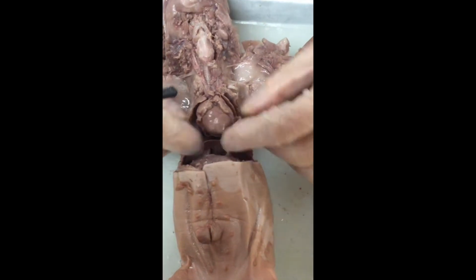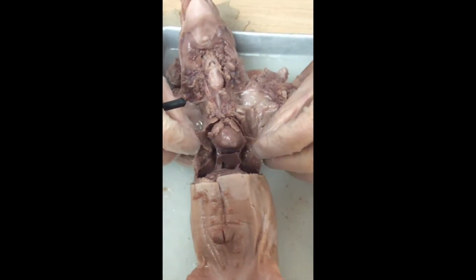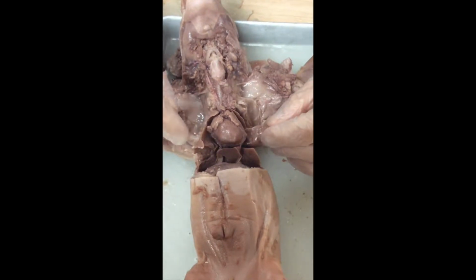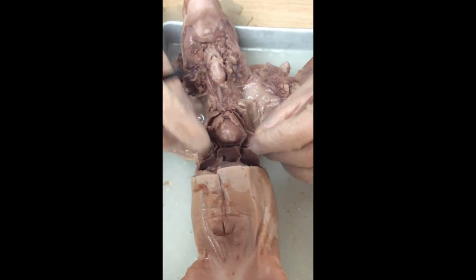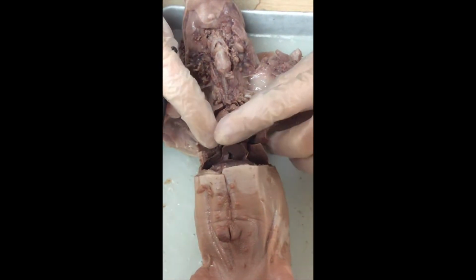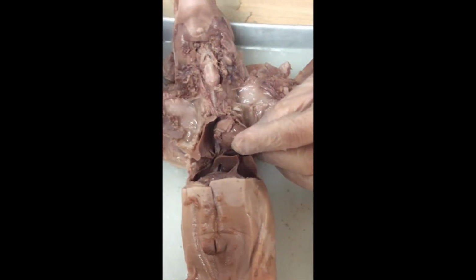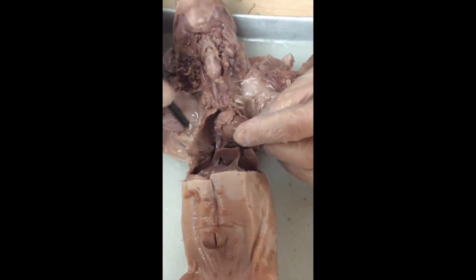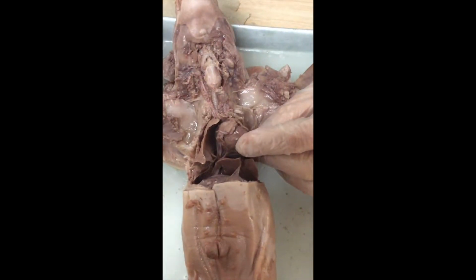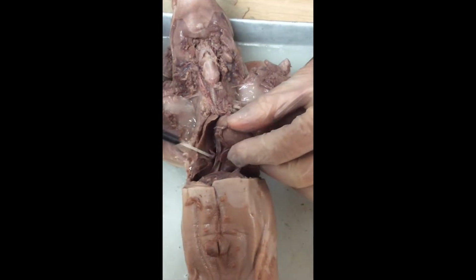These large organs on the right and left side of the heart and below the heart, these are the lungs. And you would notice that the lungs are in fact not one single structure, but actually multiple structures all put together. We use the terminology lobes. There are several different lobes of lung. During dissection on Thursday, Ms. Carr will lead you. I would like you to count the number of lobes of lungs. That will be one of your responsibilities.